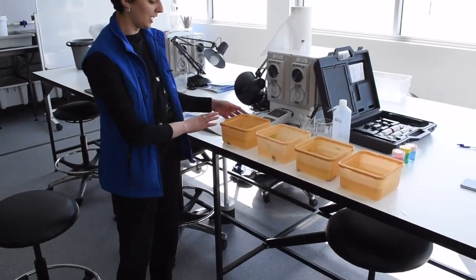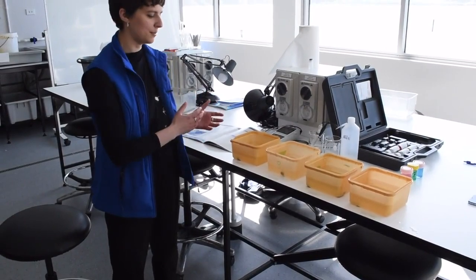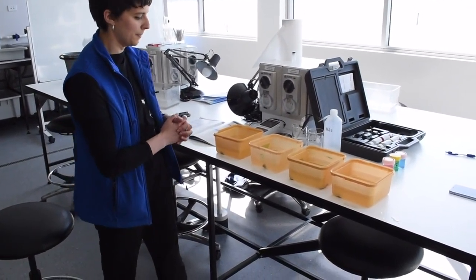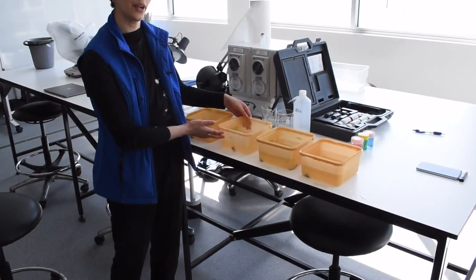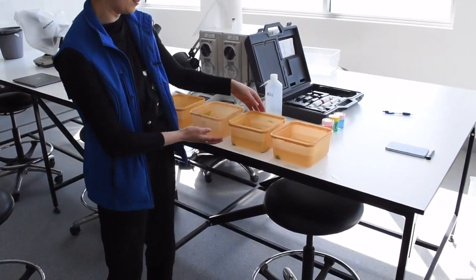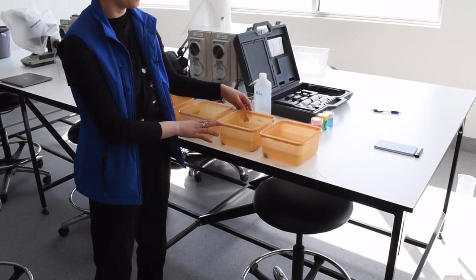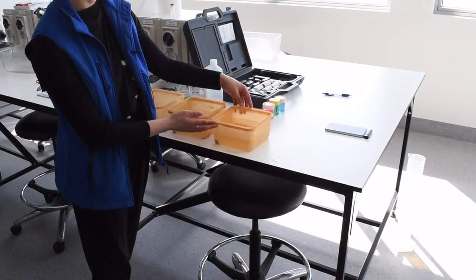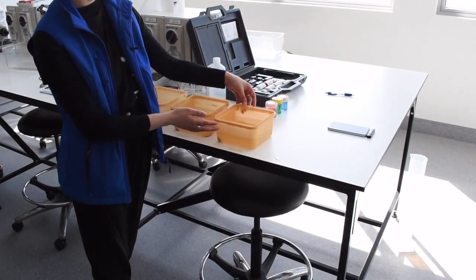For our experiment today, we're going to have 4 different treatments. We have a control treatment, which is just the seawater that we got out of our taps today, the current conditions out in the ocean in the Otago Harbour. We have increased temperature, which is water that we've microwaved like we did in the previous activity. We have a treatment of lowered pH, which is made by blowing through the water with the straw. And we have an experiment where we've got increased temperature and also lowered pH.